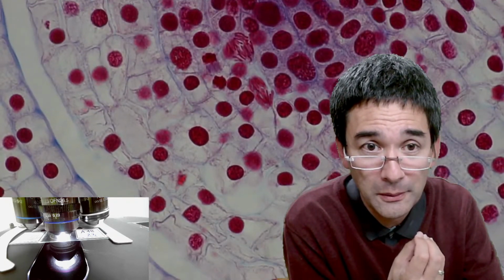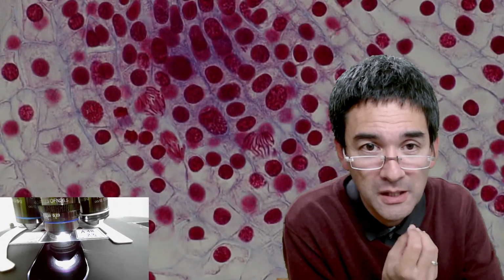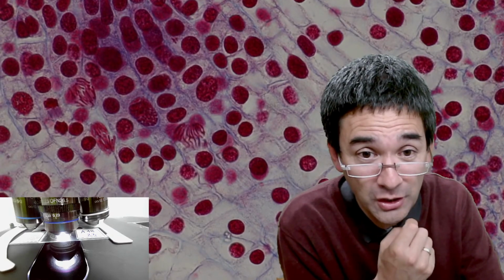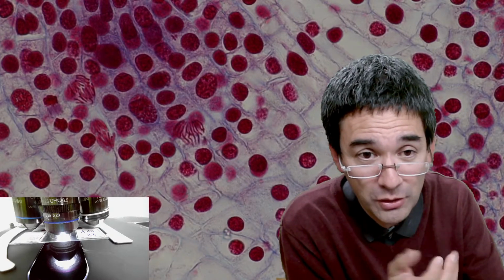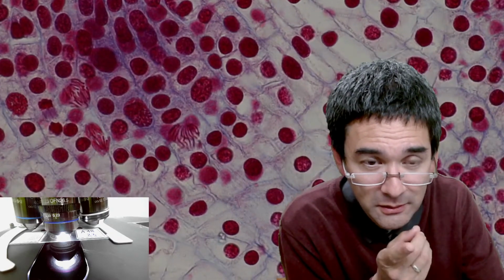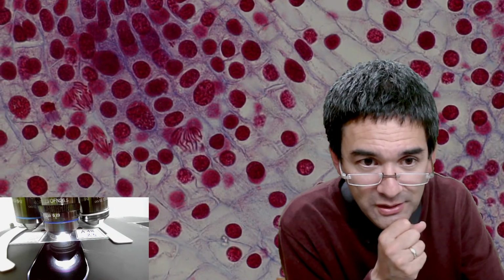All of this, and also, for example, when you look at dividing cells under the microscope. Here again, some beautiful chromosomes. It's interesting for me as a biologist and as a curious observer of nature. Even though I studied this stuff, I've got a major in microbiology and a minor in biochemistry, it's still fascinating that all of those complex life processes, when you break it down, are ultimately complex chemical reactions.